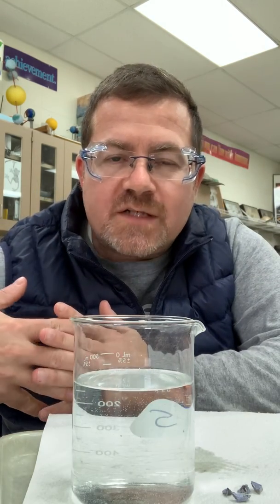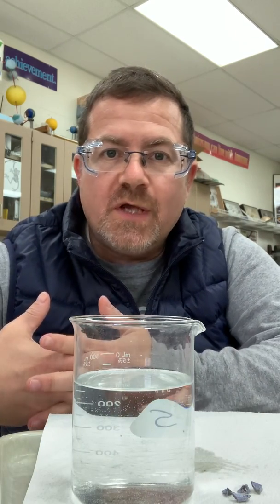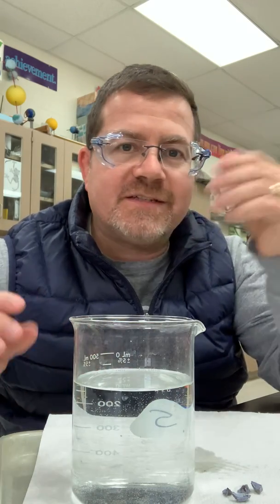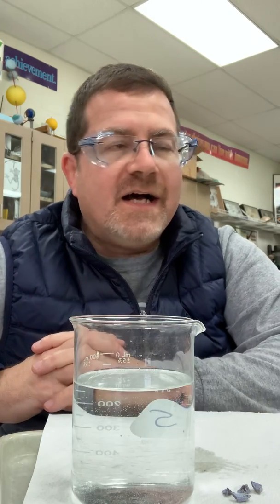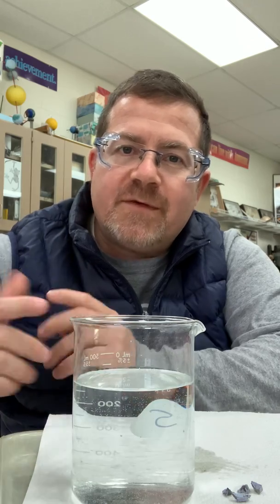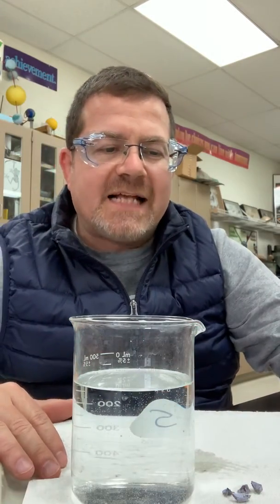All of these alkali metals, as we talked about in our guided notes, are highly reactive, which is pretty cool. By the way, I got my goggles on because these are super reactive. The next one down on the periodic table, rubidium, I would not do in front of my camera without a shield. But for potassium, I can do this.